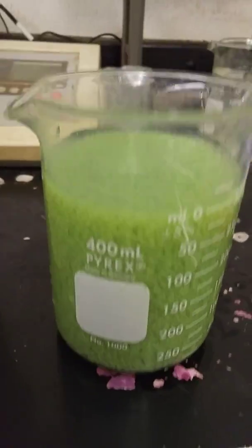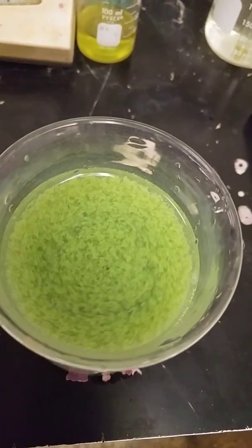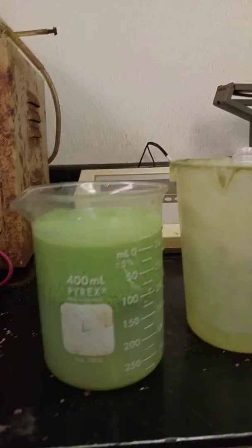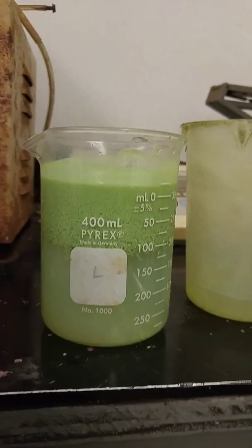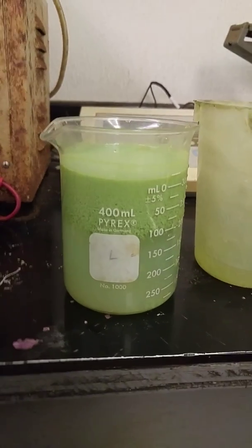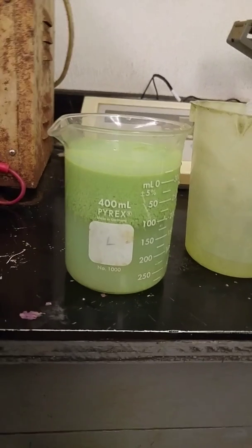Isn't that crazy? It goes from almost a clear glass of water with just a few drops of this chemical — this is what it turns into. After a little while it will all rise to the top, and there it is. When we add polymer it makes it stick together and weighs it down so it will actually wind up sinking to the bottom. Pretty cool.